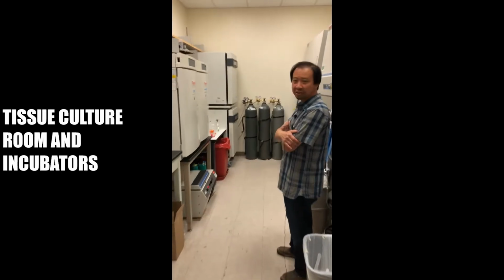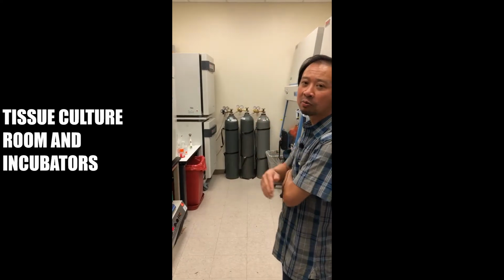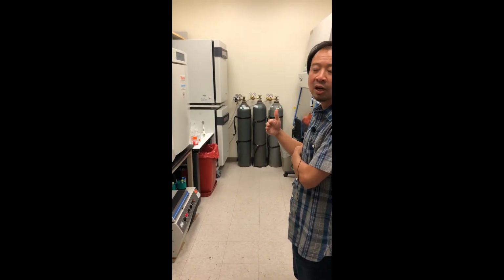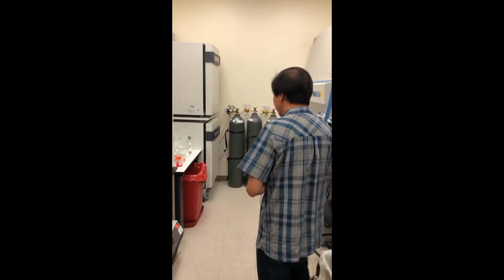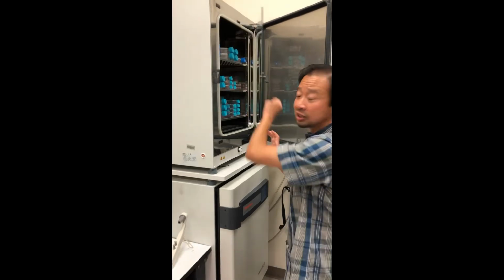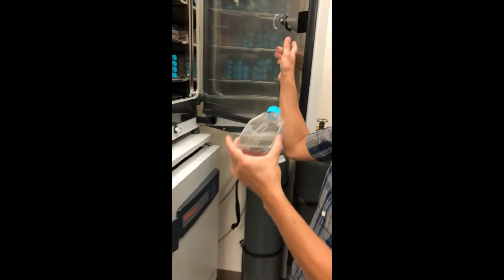So here is our tissue culture room, and what we have here are tissue culture incubators where we maintain live cells. They're maintained at 37 degrees at a constant CO2 percentage to maintain the cells and keep them happy, actually. Here's an example of one of our cell lines that we use. Actually, it's a ROS1 cell line that we have derived from a patient.